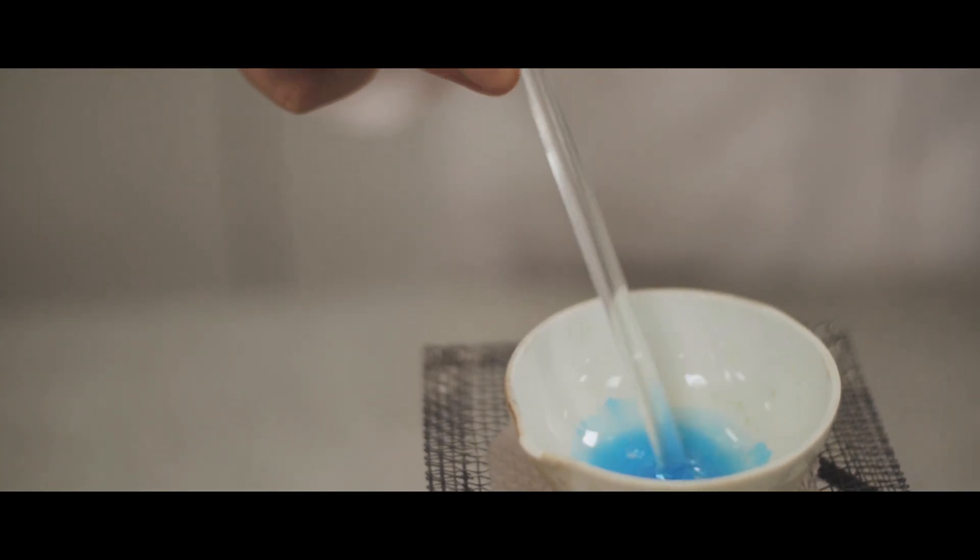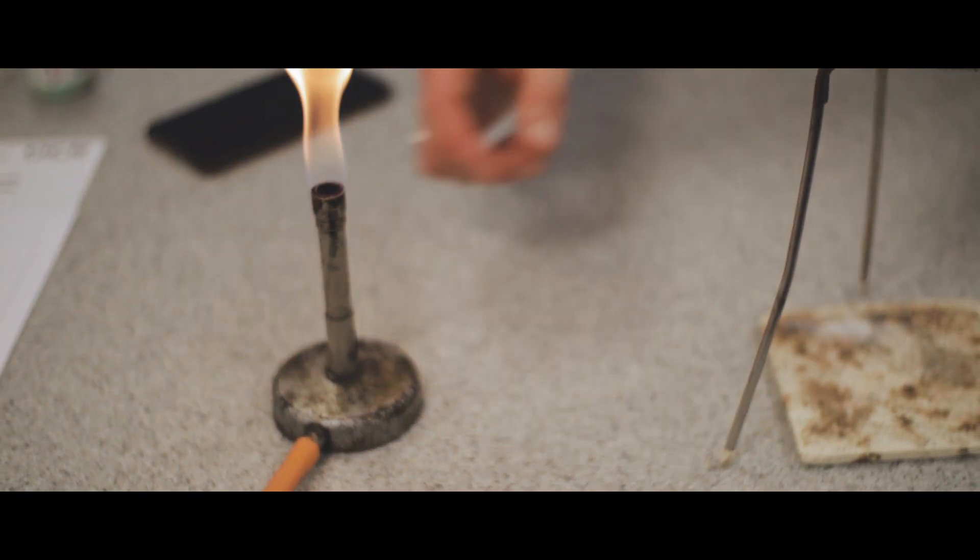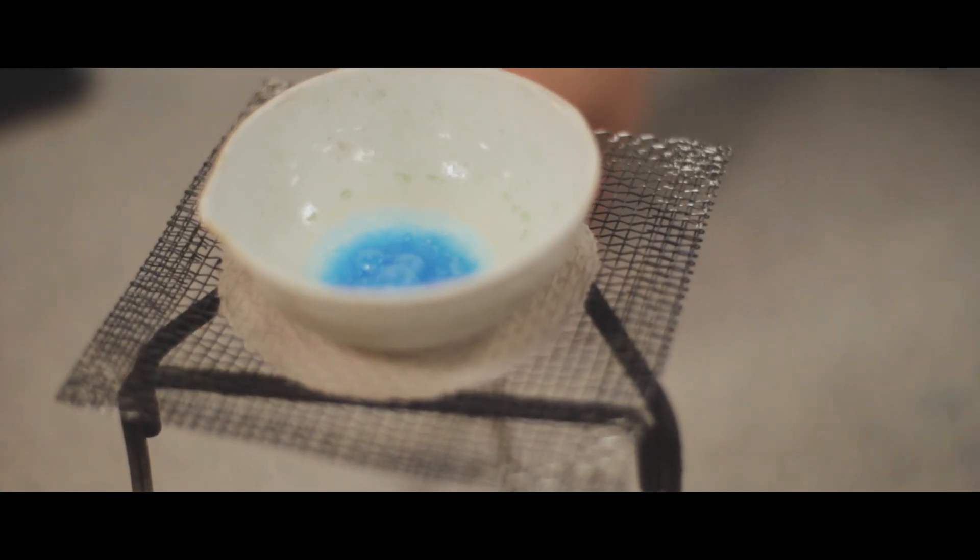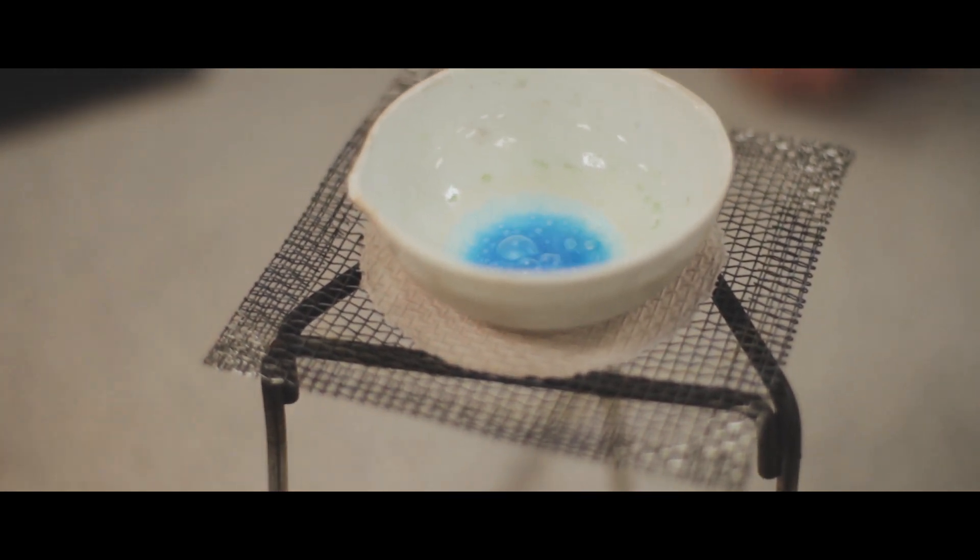So we start to see some crystals forming on the edge. It's starting to become concentrated. So if I remove the heat, then what we'll do is leave that remaining solution just to finish evaporating and leave our crystals behind.